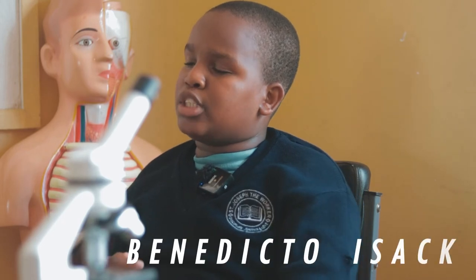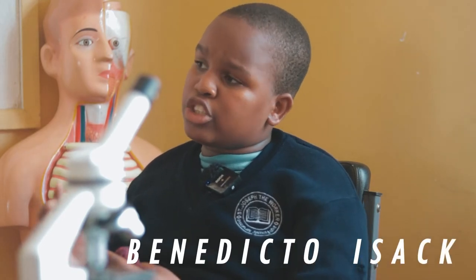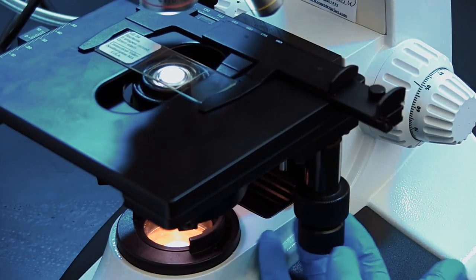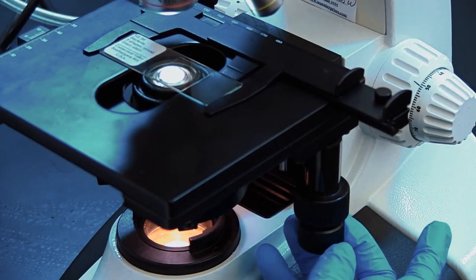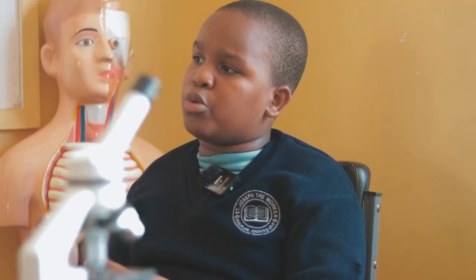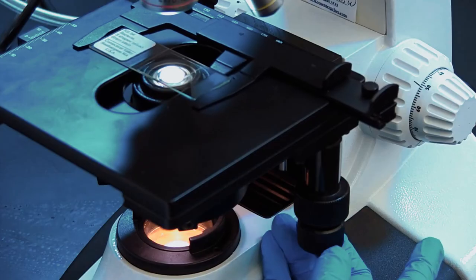The stage is the section where you place the specimen for viewing. It is used to hold the specimen slide in position. The most common stage is the mechanical stage, which allows control of the slide by moving it using the mechanical stage knob instead of moving it manually.